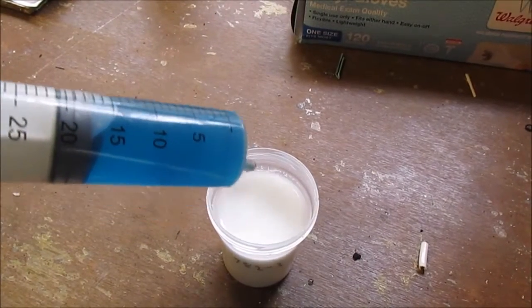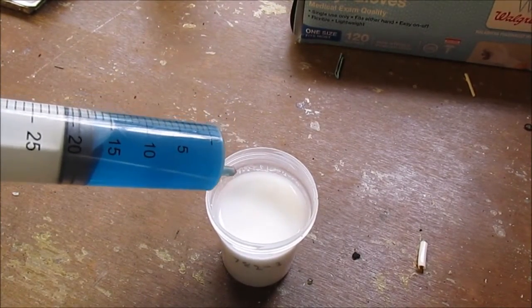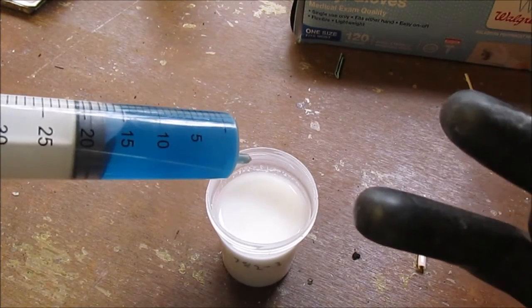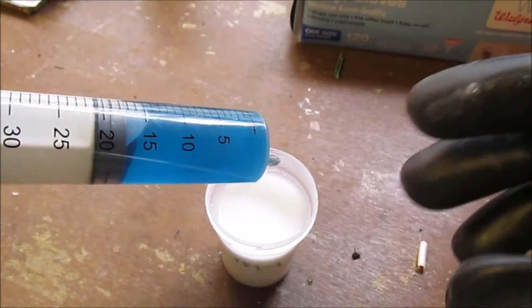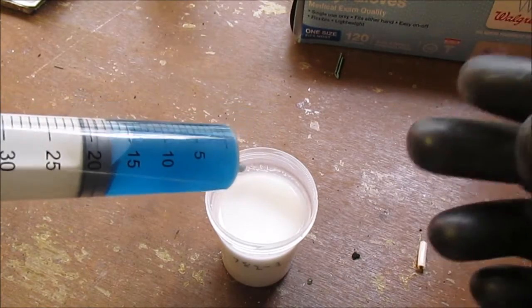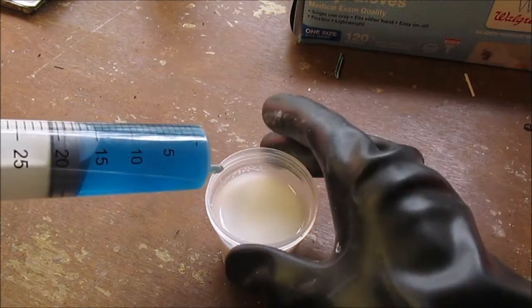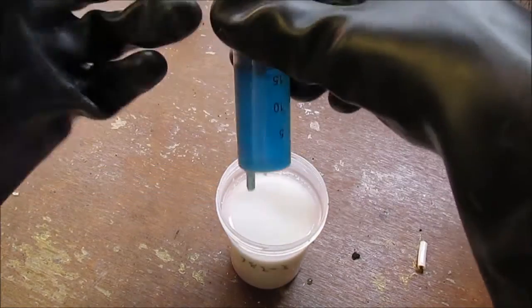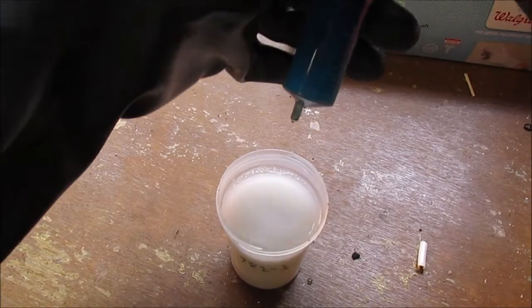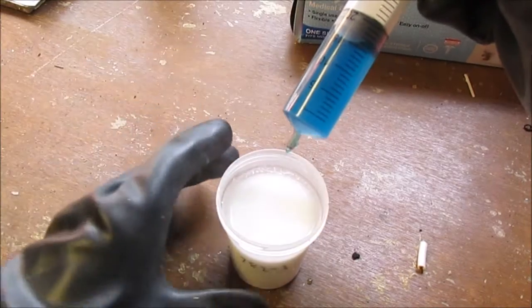Okay, so here we are. Now I've got the copper sulfate, and we should see two distinct precipitates forming. The copper sulfate reacting with calcium hydroxide should form calcium sulfate, which you probably won't be able to see due to the milkiness of this solution. And then, of course, we'll also be forming copper hydroxide, which is also a blue color. So, let's see what this looks like.